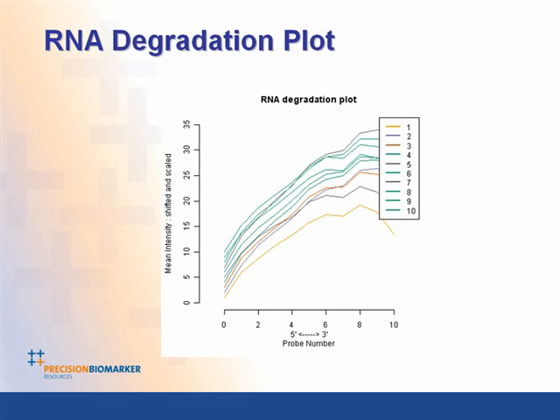In addition to looking at the housekeeping genes, GAPDH and beta-actin, for RNA quality, one can also look at overall RNA degradation plots. In many of these chips, there's approximately 11 probes per gene. And while an individual gene may have different intensities across these chips, there is a tendency, just like with the beta-actin and the GAPDH, to have higher expression at the 3' end than at the 5' end.